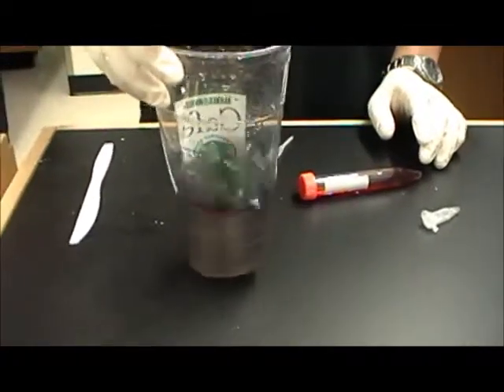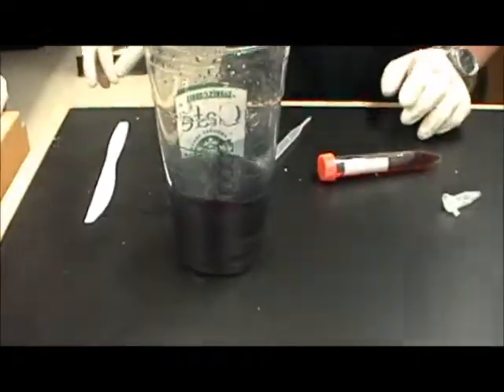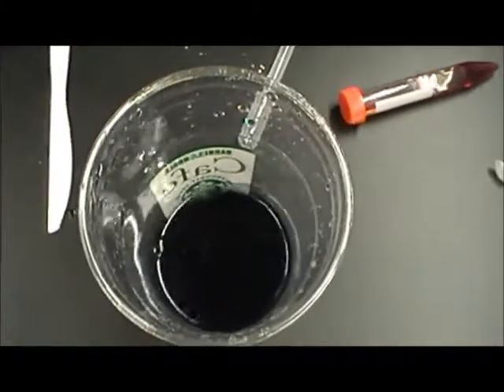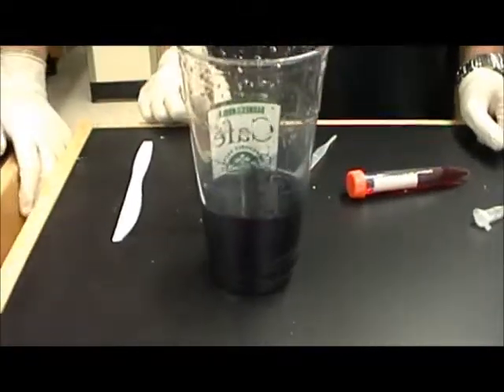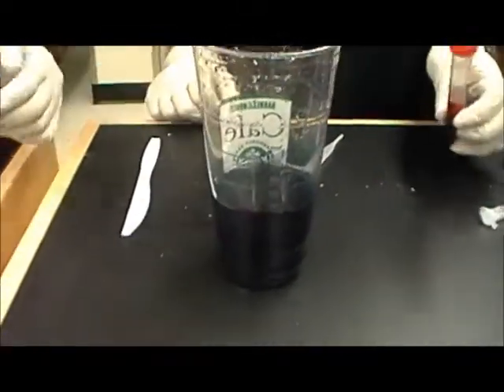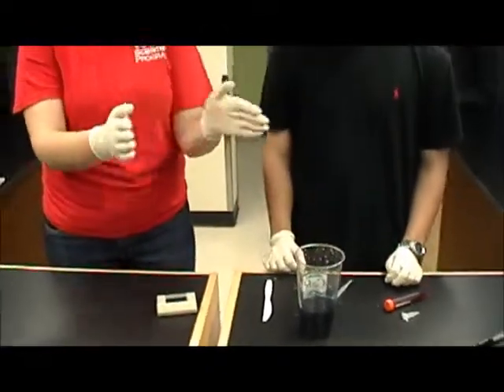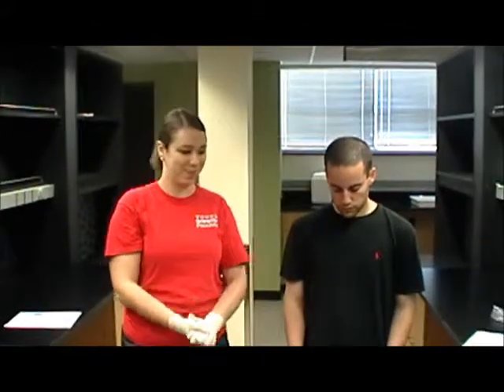And after it mixes completely with the starch, you can see that it produces this purple color, which is quite dark here. The intensity of the purple will of course depend on how much starch and iodine is in there, but this should be a good demonstration to the students that once iodine and starch can touch and are no longer physically kept from each other, they create a purple color.